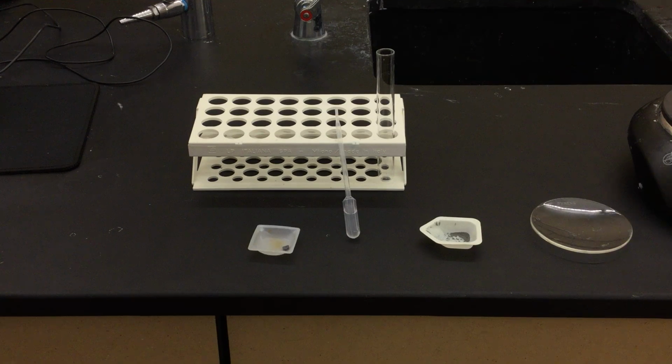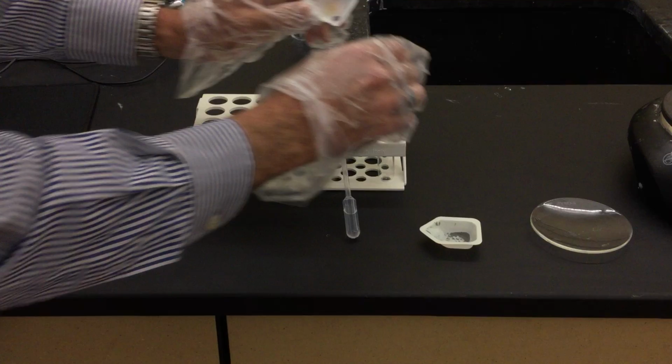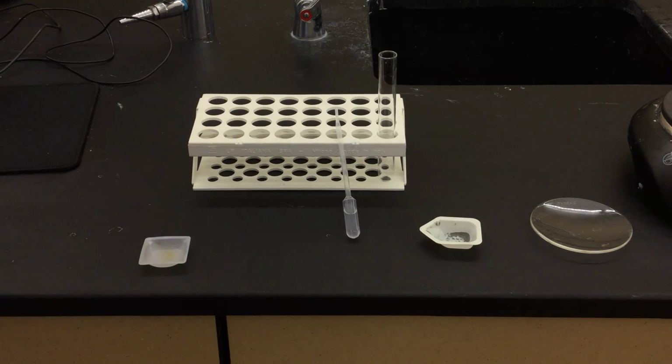So we're going to go through this procedure. We're going to add one large granule of iodine to a small test tube. So here goes the iodine into our test tube. So there's the iodine. Nothing else is in there as of yet. Okay. Now note the initial color and the appearance below. We're going to discuss that a little bit later because you saw what that looked like.